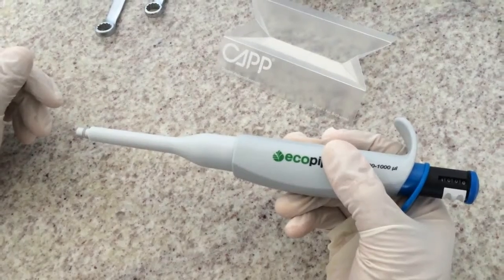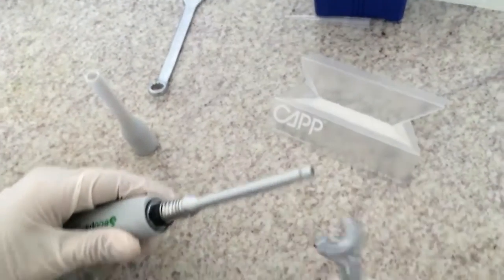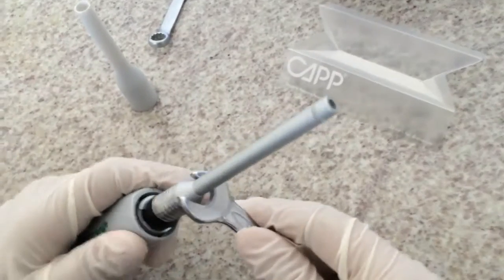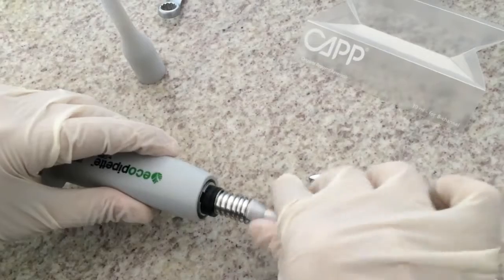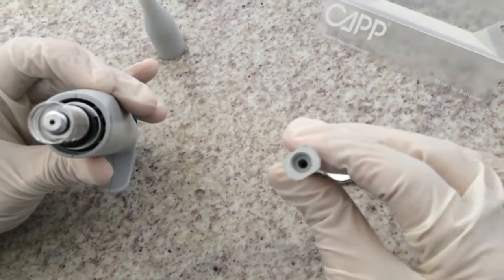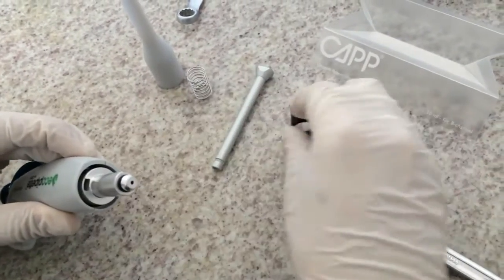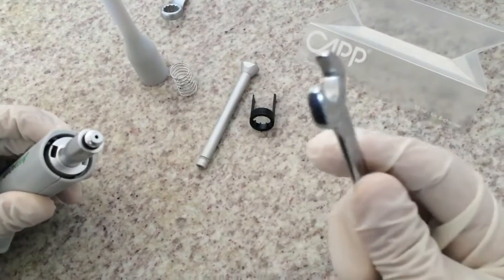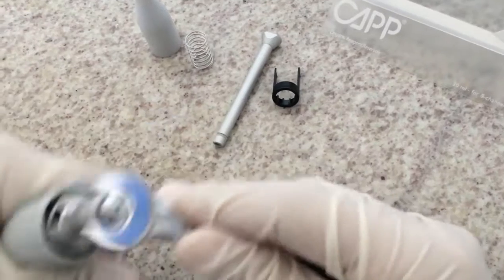Take the tip ejector off the pipette and unscrew the tip cone using an 11mm wrench tool. Check if the tip cone or bottom part seems to be contaminated. Then you can again use an 11mm wrench tool and disassemble the bottom part.